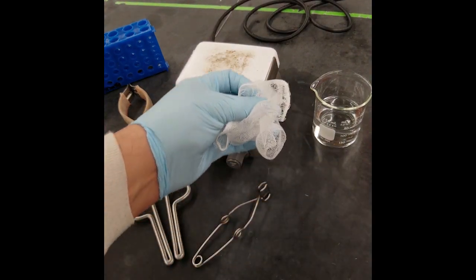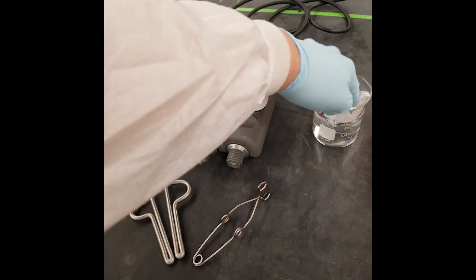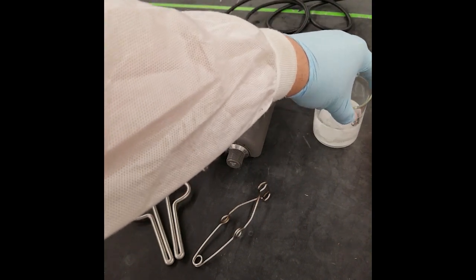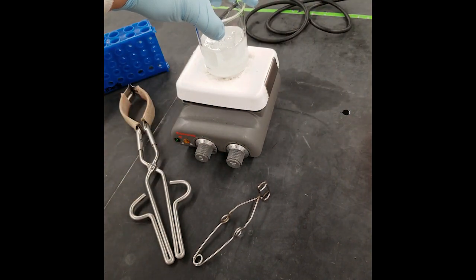Place your cheesecloth in the beaker filled halfway with deionized water, place the beaker in the center of your hot plate, and then turn on the hot plate by dialing the power to around 60 to 75 percent.